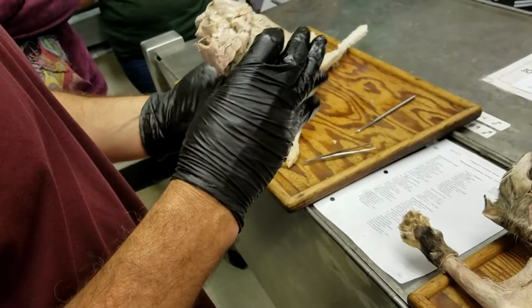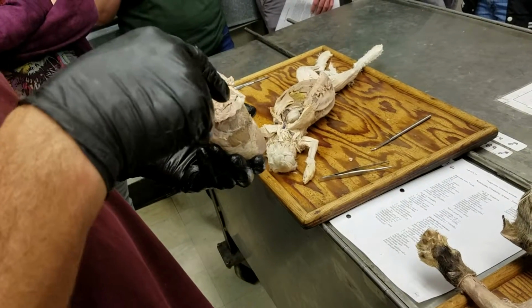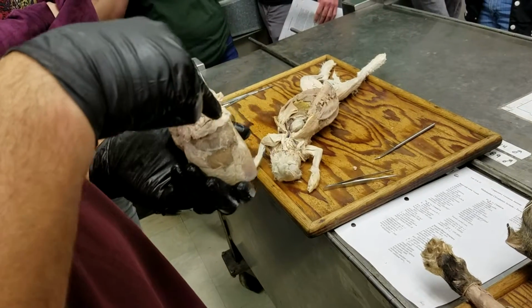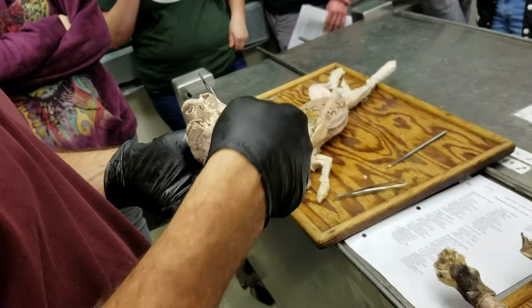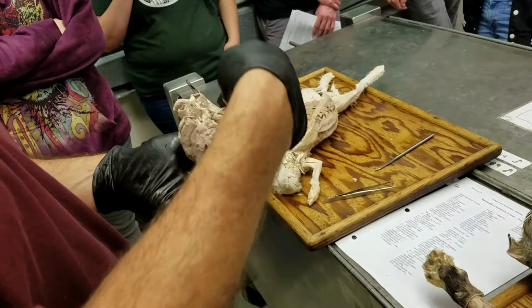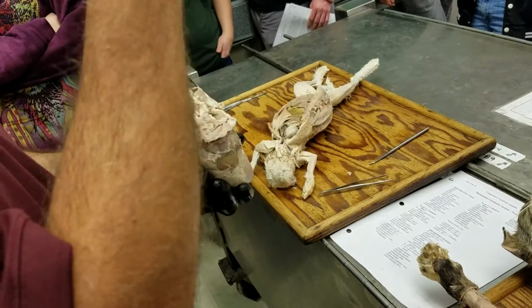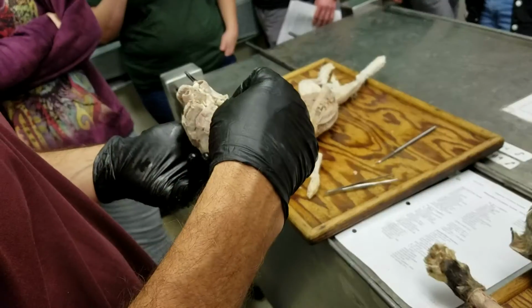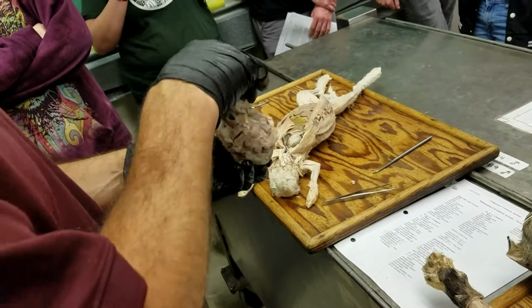Pretty cool. And you can kind of imagine, just looking at this here, that this is the cranial vena cava from the left side and from the right side, coming together. Basically, we're looking at the two common cardinals coming in to the heart, with the anterior cardinals, namely cranial vena cava, coming in to that section.